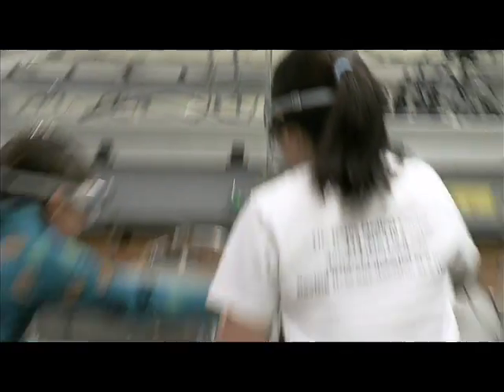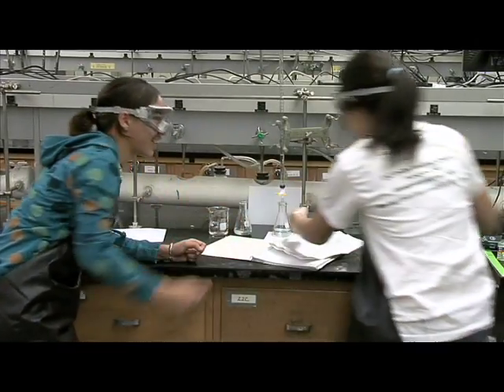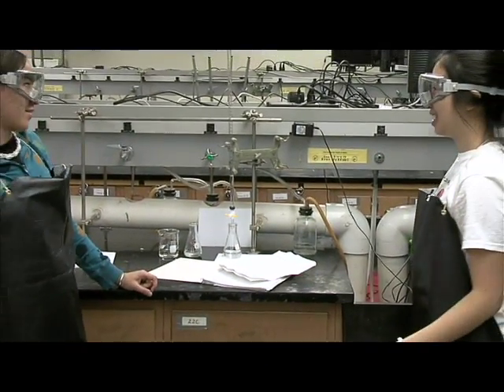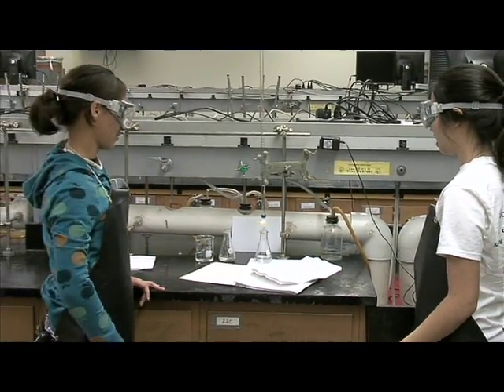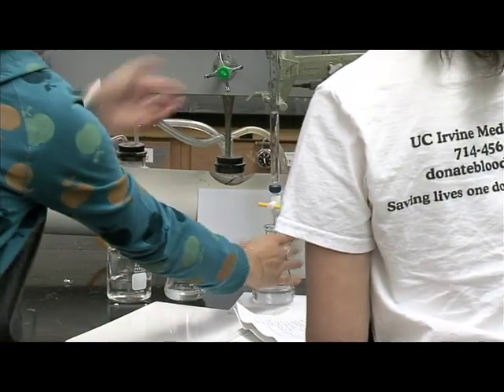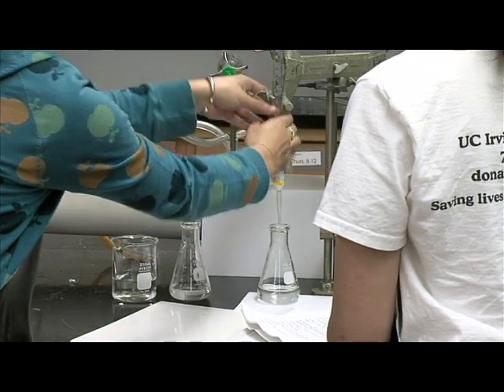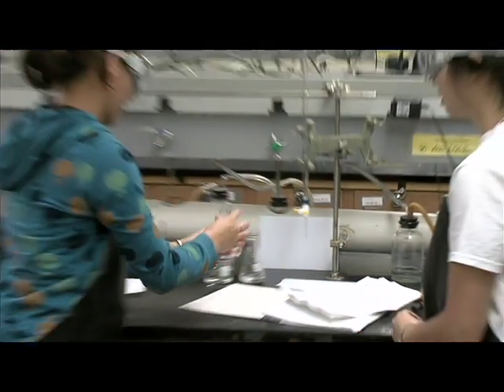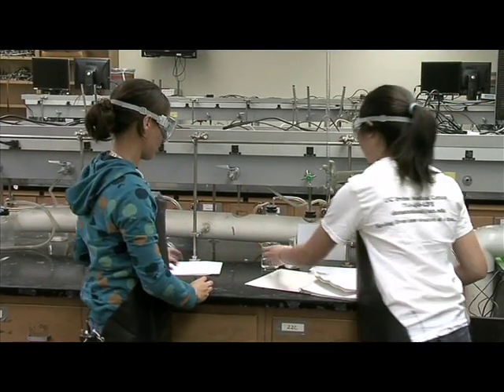Wait! Oh no! You're supposed to close the stopcock! Cause the burette's leaking! Wow, that's not how I would have thought about it, but okay. Okay, I'll fill it up again. Okay, and I'll make a new reactant! Thank you for ruining everything! I hate you! I hate you too!